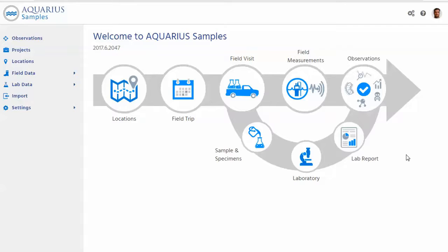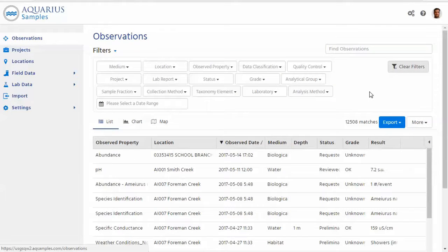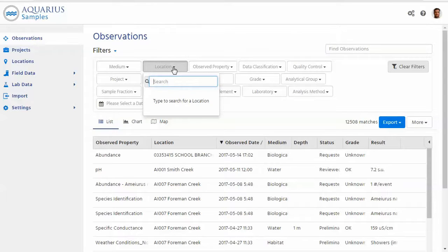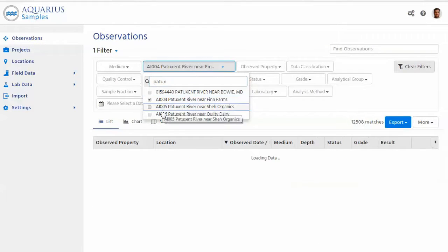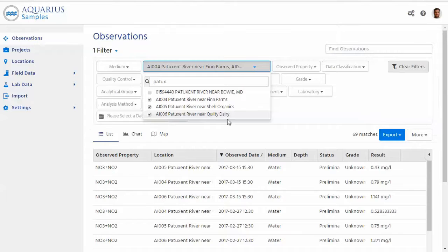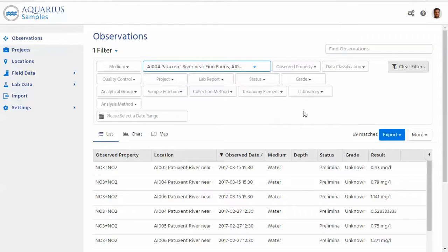As usual, I'm gonna use my workflow diagram to jump to observations and start drilling into my data to find the relevant locations. So I'm just gonna type the Patuxent River right there, and there we go. Here's three locations, one of them being the Quilty farm, and we're gonna look at some other locations as well to give us a bit of a better picture on what's going on.